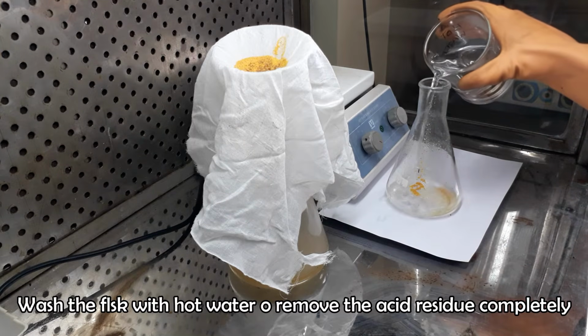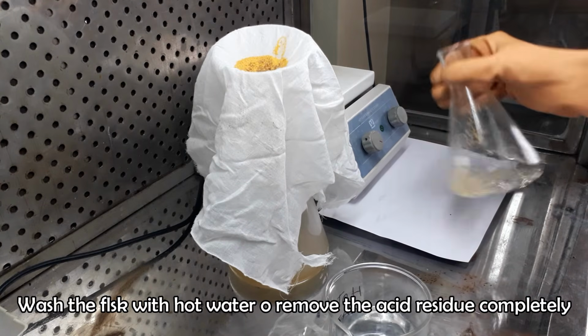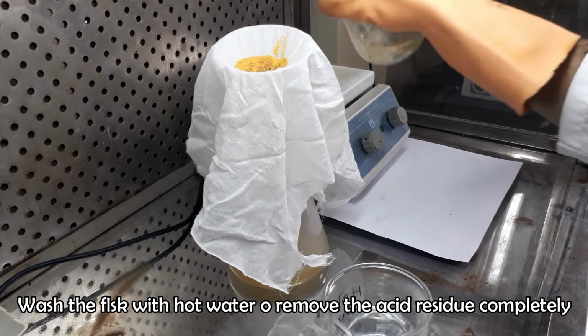Wash the conical flask and the filtrate with hot water to remove the acid residue which could interfere in the next step during boiling with basic solution.